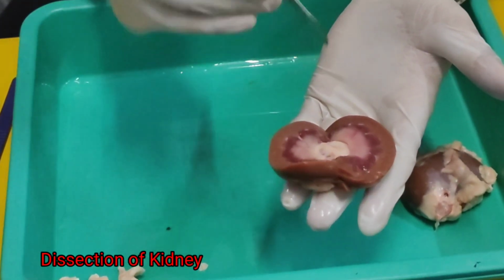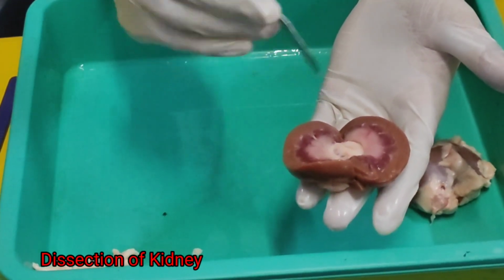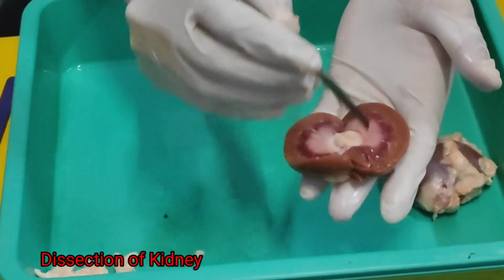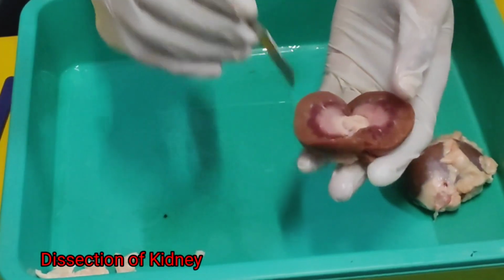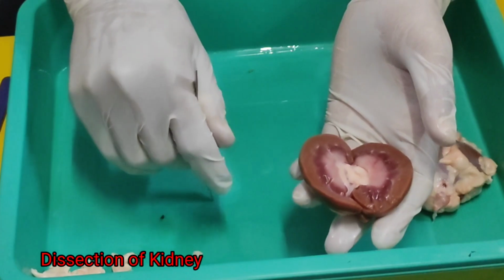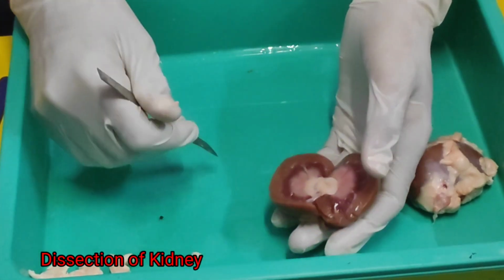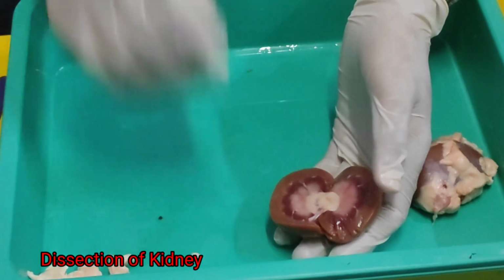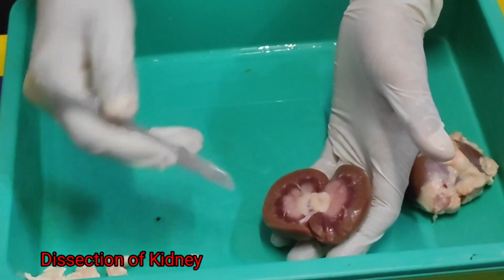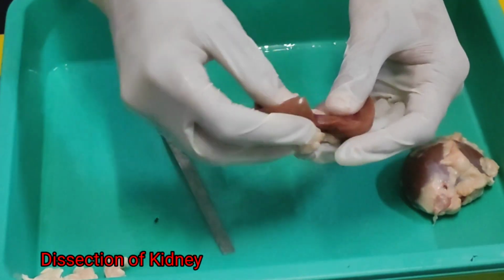Each nephron has a function to filter what? The blood, and that basically removes the nitrogenous waste. So this is all about the internal structure of the kidney. Keep in mind, the main function of the kidney is removing nitrogenous waste. Along with that, the drugs which we are eating will also be filtered from the blood, by the kidney only. So this is all about the kidney's internal structure.